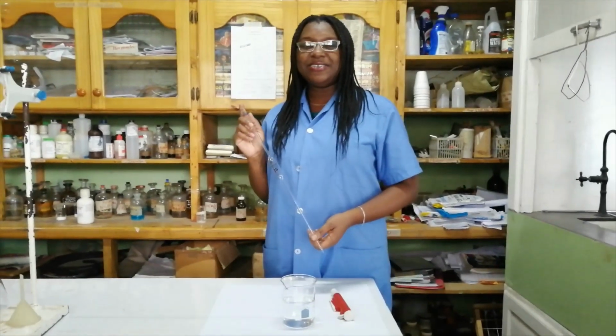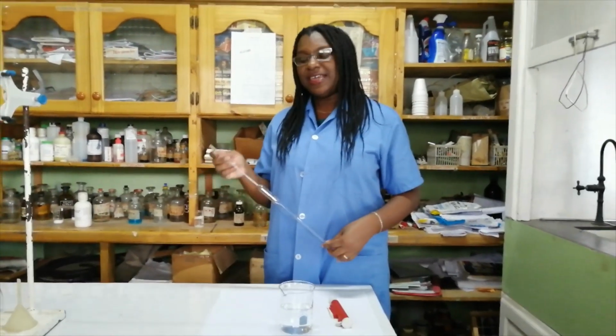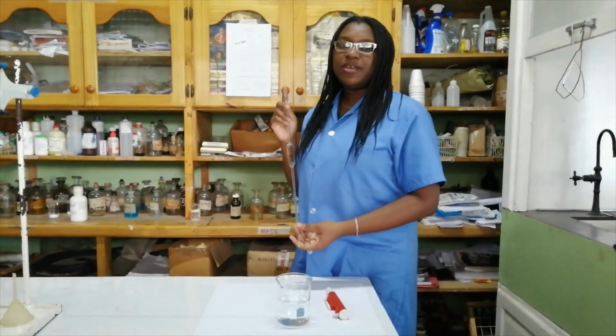Hello students, this is your teacher Mrs. C. Williams-Massey, and today we will be talking about the volumetric pipette.